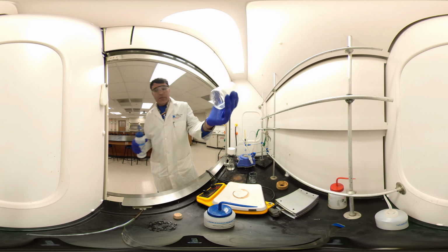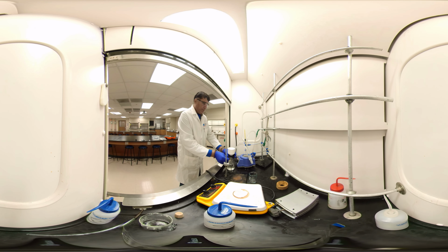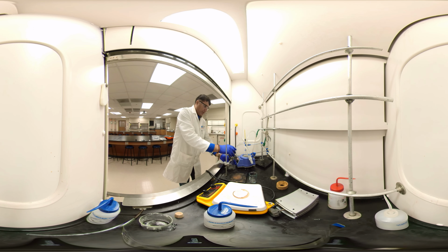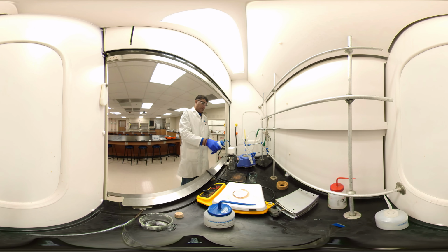I transfer everything, so now you need to wash more. We'll make it empty. So I'm going to wash more with ice cold water. Ice cold water I have here.